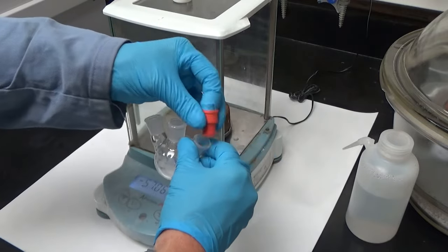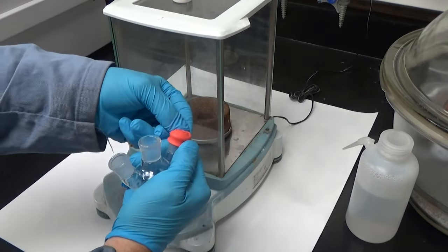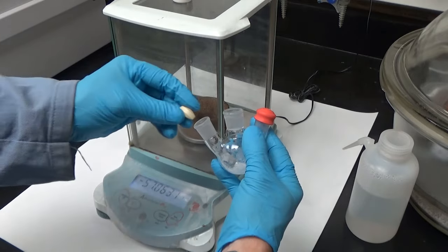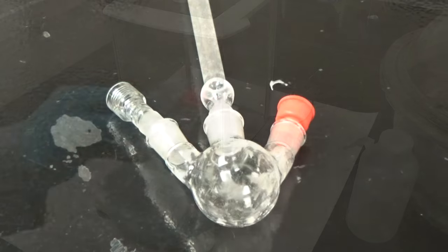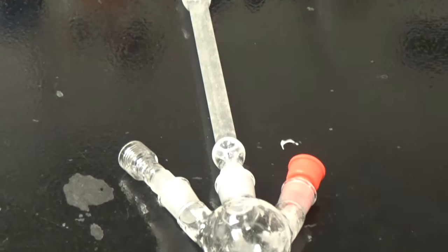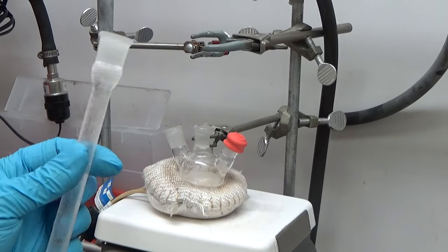Now that we're done, we have a little septa. That's where we're going to inject the sulfur dodecylamine solution. And if you're like me, I almost forget every time to add the stir bar. So I better remember that. And here's what the setup looks like with the condenser and the temperature probe adapter.